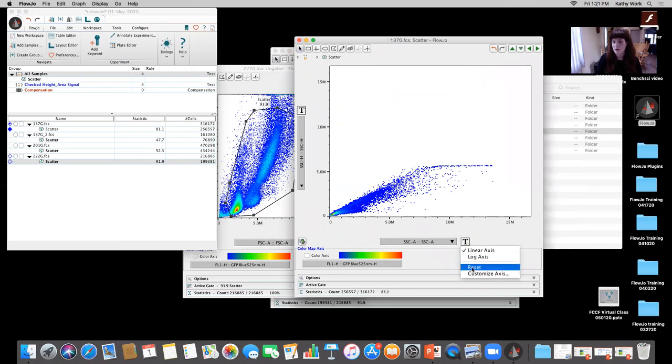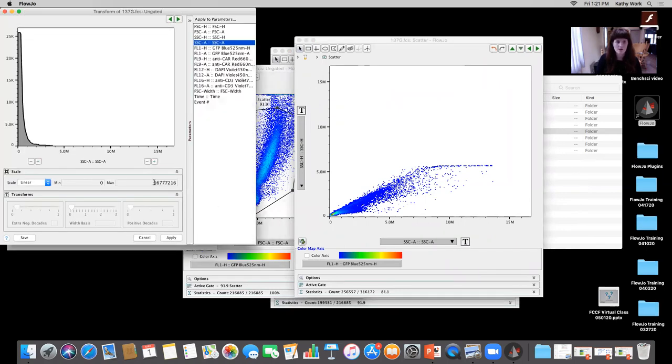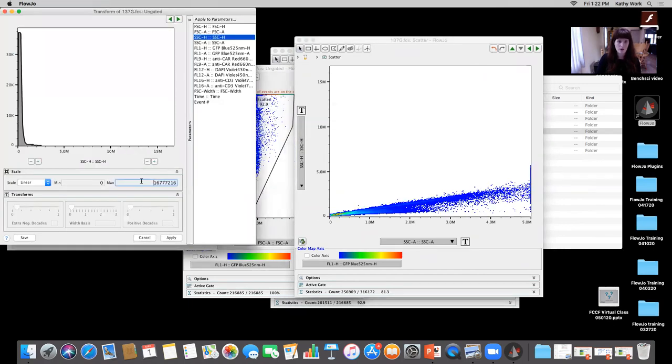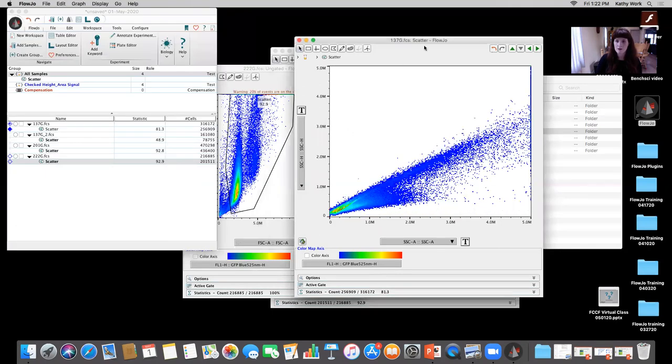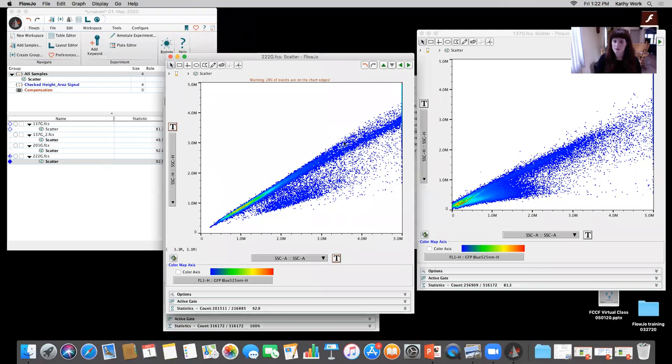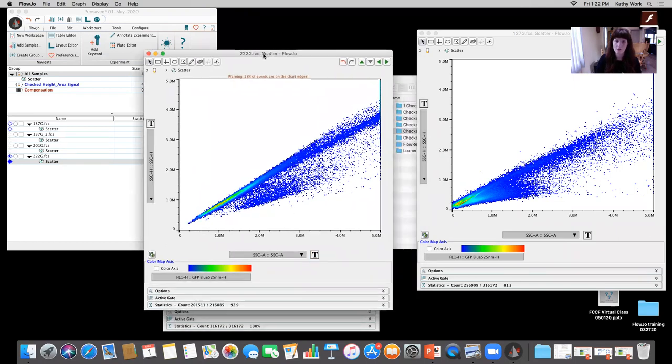So then I can come back in and use my transform, customize the axis, and change the max to about 5 million. When I do that for this sample, where I know I'm no longer reaching the plateau or the saturation point of the height, I'm going to be able to do a much better determination of my single cells, and you're not going to see the point where it reaches that saturation.